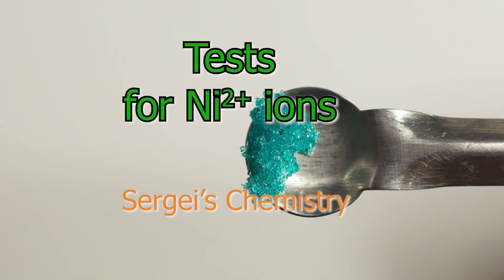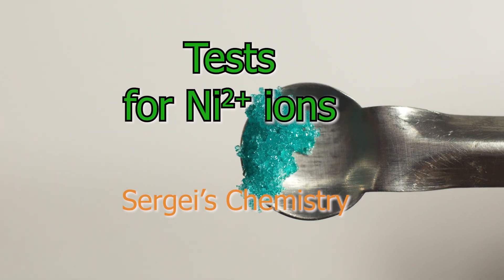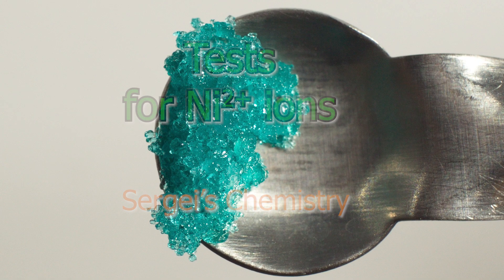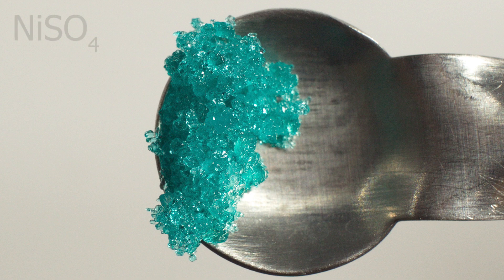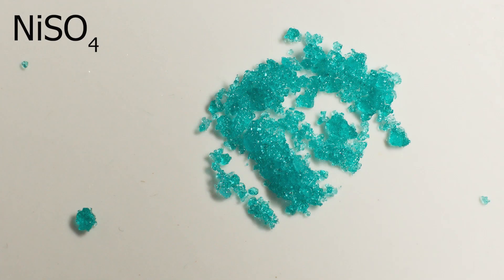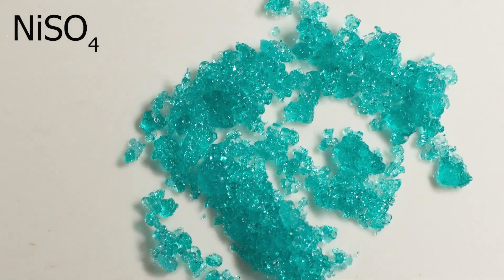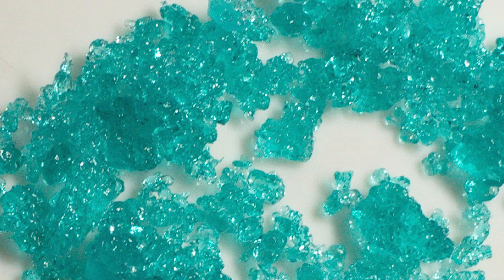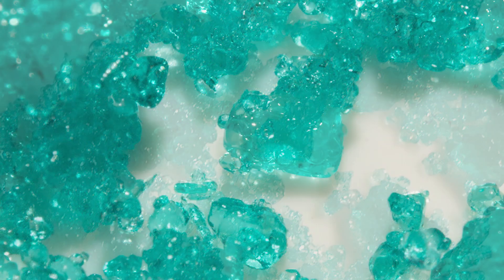Welcome to Sergei's Chemistry. Today we are looking at nickel-2-ion tests. Here you can see nickel-2-sulfate crystals — a green solid, well soluble in water.